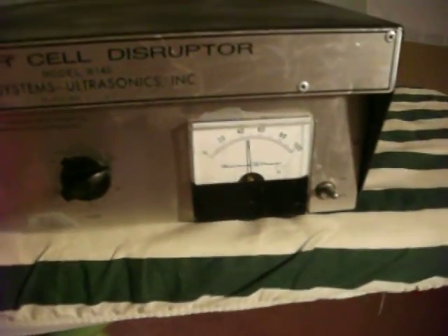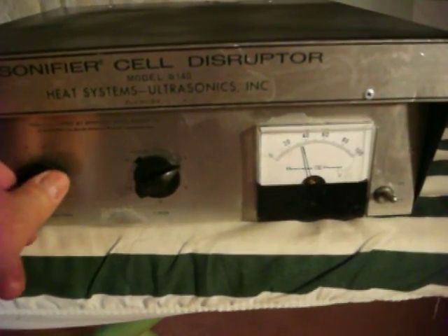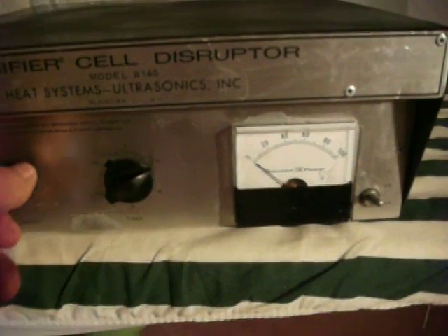It likes to move away. Making the glass thing vibrate tells me the transducer is doing something. So there we have it. And let's see, we'll turn the gauge back down, and it goes down there too.